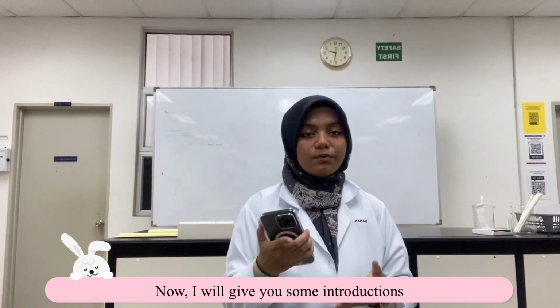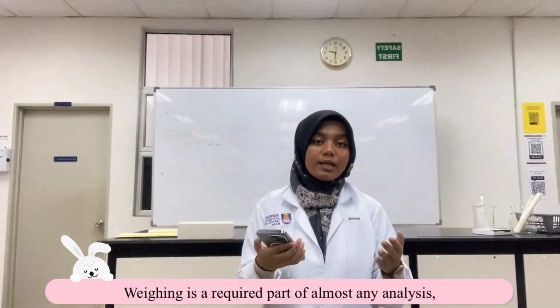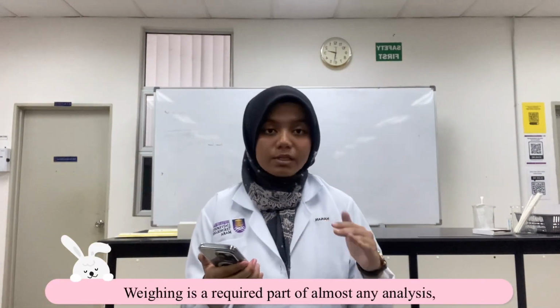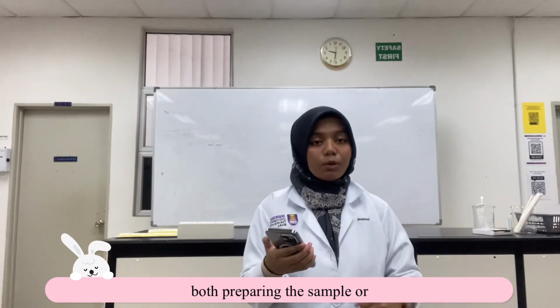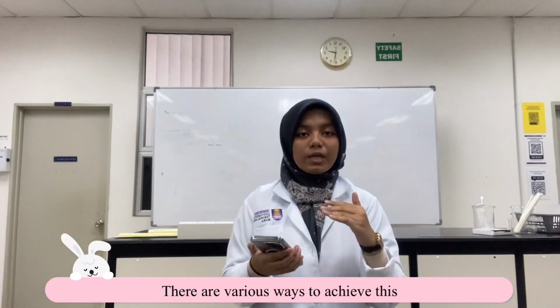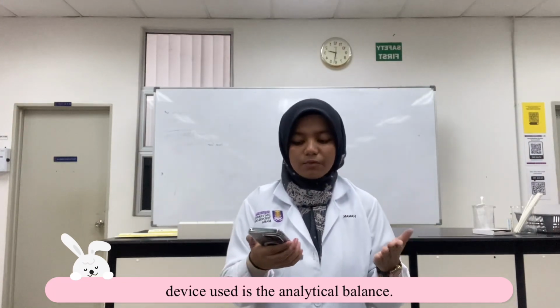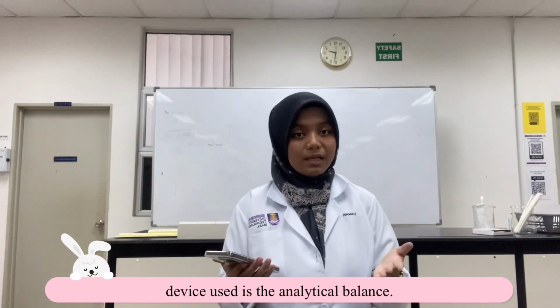Okay, now I will give you some introductions about weighing balance or analytical balance. Weighing is a required part of almost any analysis, both preparing samples or standard solutions. There are various ways to achieve this, but the most useful and versatile device used is the analytical balance.